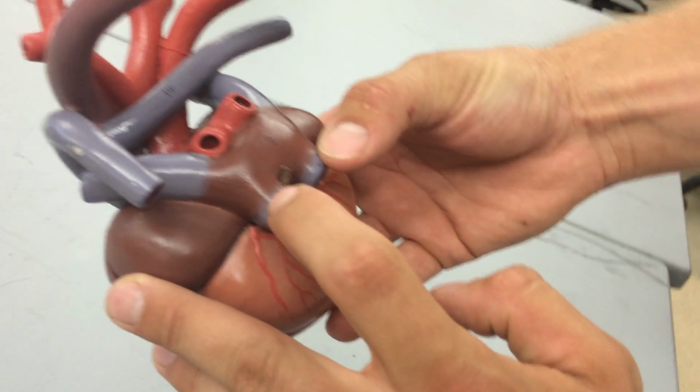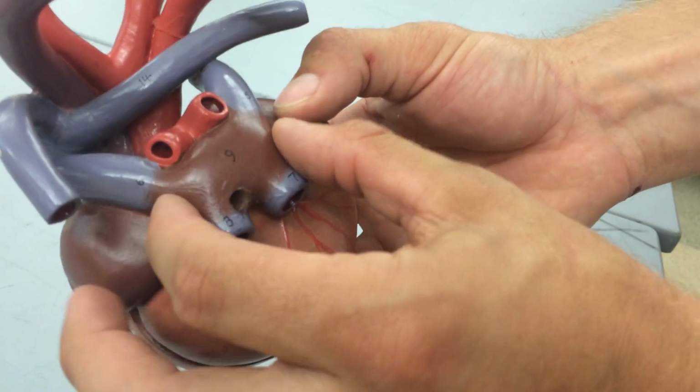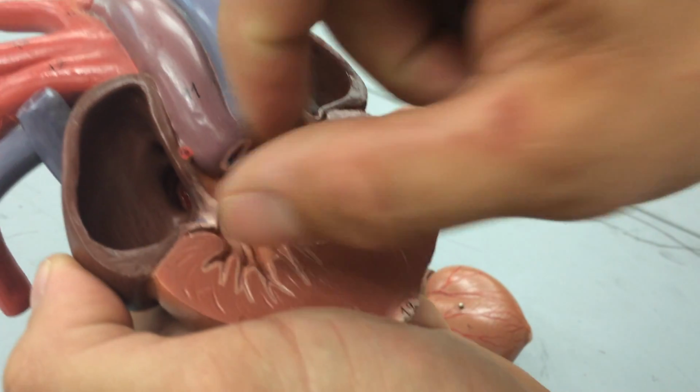and the right caudal vena cava, okay, which are going to feed into the sinus venosus. Okay, the sinus venosus is going to feed into the right atria. Okay, here's the right atrium right here. It's going to flow through this valve, which is called the tricuspid valve.